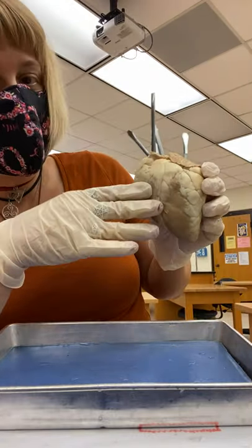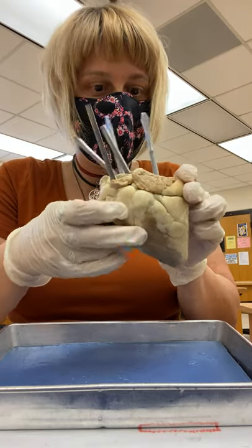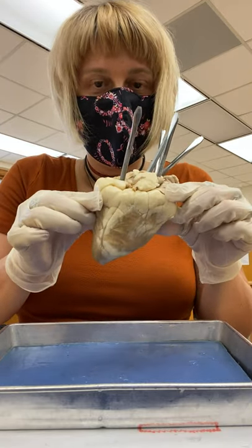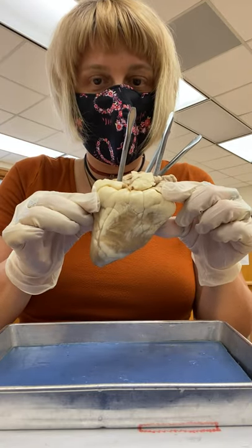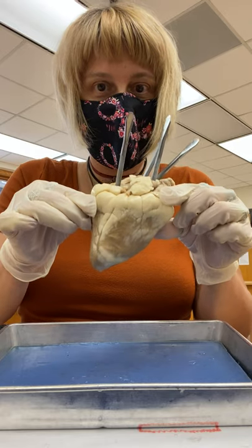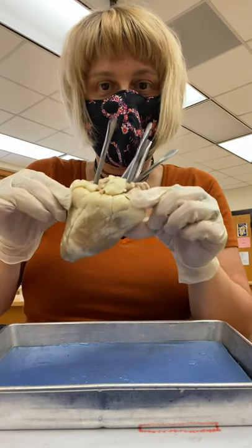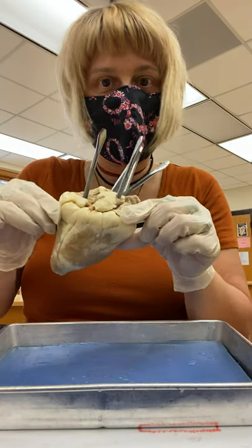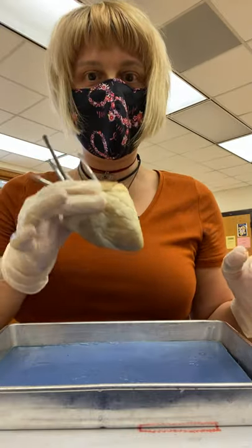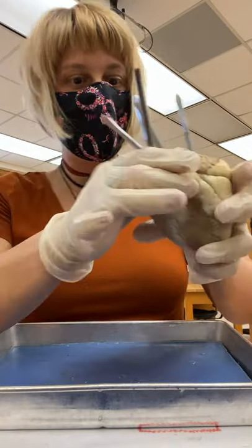How do I know that this is anterior versus posterior? Remember how I taught you — this is the posterior aspect, and the apex is facing right. So that's not how it's placed in the body. It's placed like this.